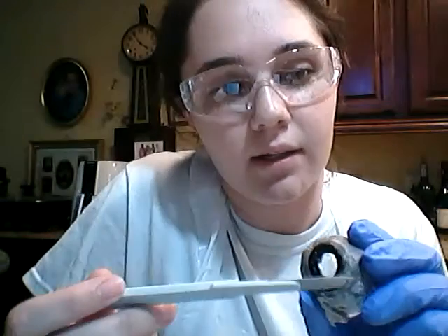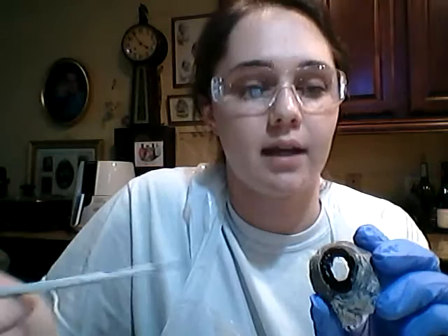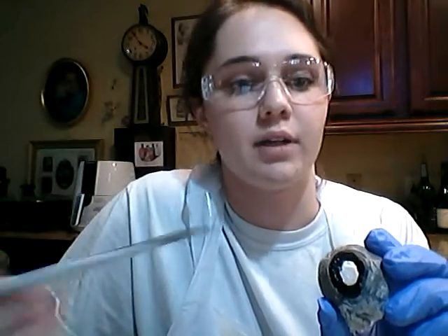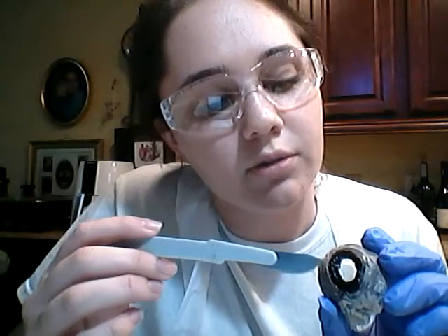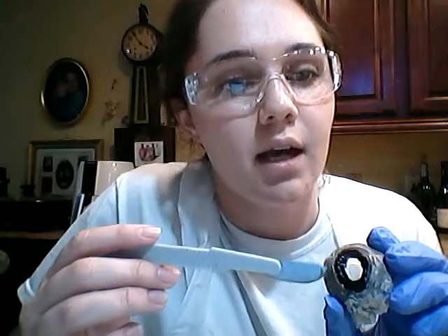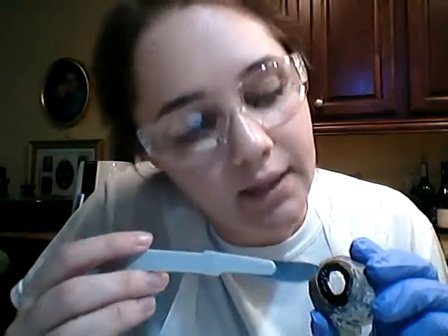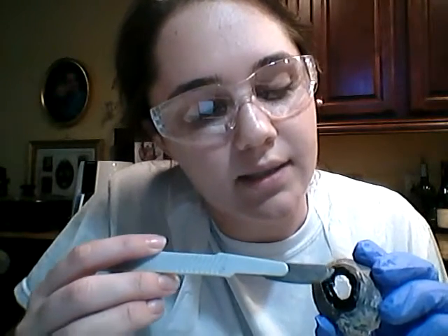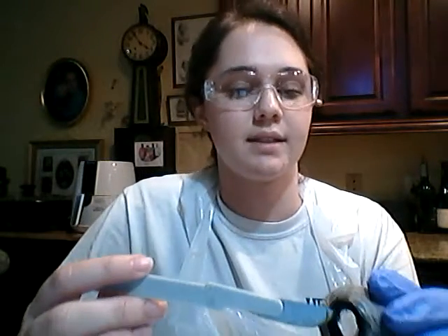So next, back to the anterior portion, you see this black part right here. This is called the iris, and this is what gives us as humans our eye color, like blue, green, stuff like that. It also is responsible for contracting and dilating depending upon how much light is in the room. And this little hole right here is the pupil.